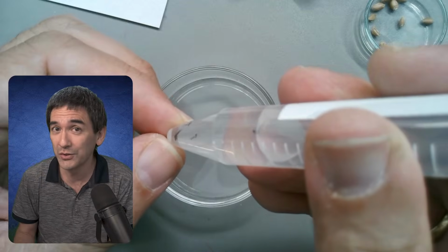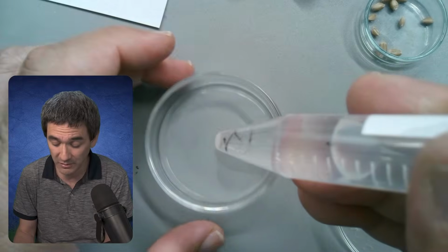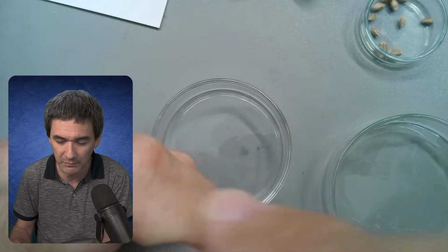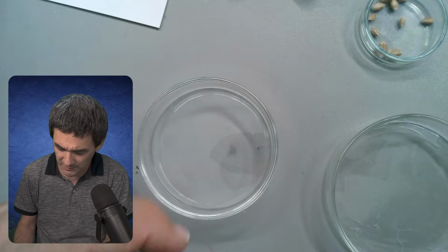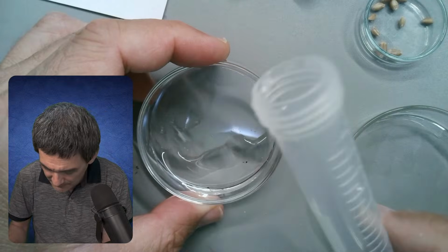And as a matter of fact, mosquitoes are considered to be actually what they call the deadliest animals in the world because of malaria. Yeah, so that's not a good sign to have those. But for our purposes, we're just going to give it a try. In any case, I just realized maybe the thing is still a little bit too large, but I'm going to simply try it in any case.